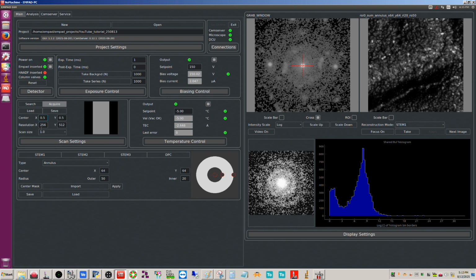So you have a lot of flexibility here with how you do this, okay? With your final area that you take the data from. Again, I would make sure it's centered. Easiest thing to do is just leave it centered and keep these at 0.5 and 0.5 because it's a little bit more intuitive. But you have plenty of flexibility here. And again, you can go all the way up to 512. So if we go to 512 here, that's now the full frame, okay?